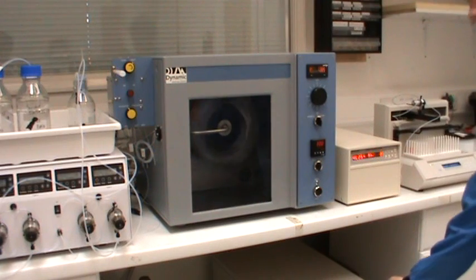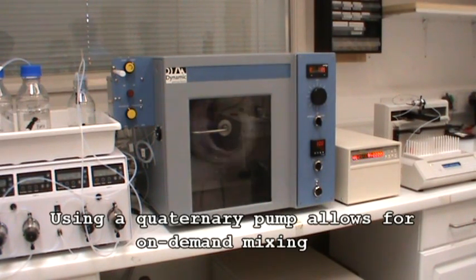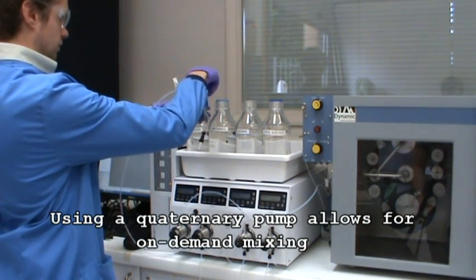Alternatively, purge the column and begin again. We mentioned earlier that using a quaternary pump allows you to mix solvent systems on demand.